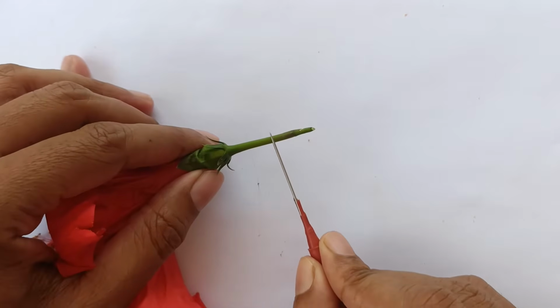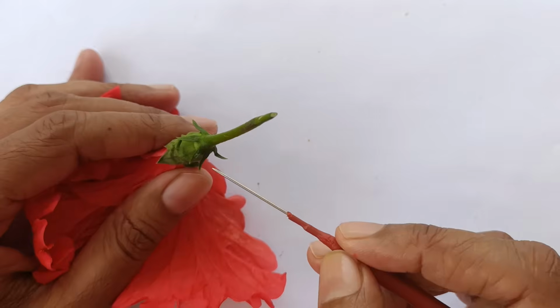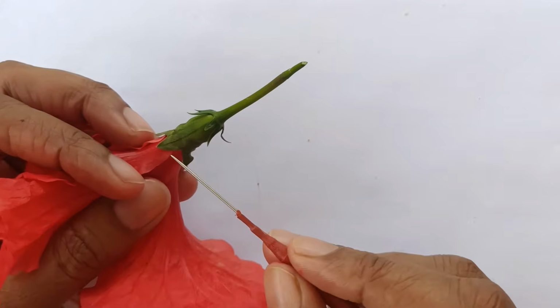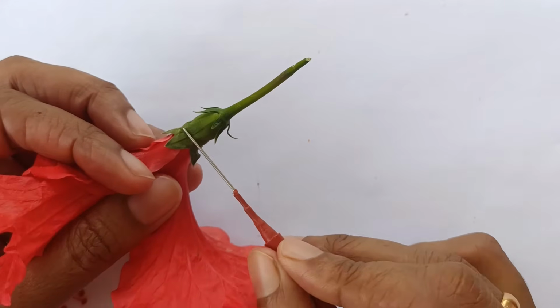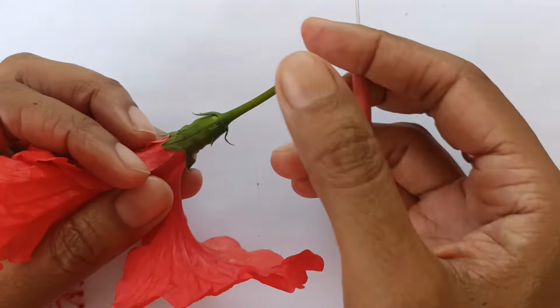This is called pedicel. This is whorl of epicalyx. You can see there are 6 epicalyx in this whorl. Then comes whorl of calyx. Unit of calyx is sepal, and you can see 5 sepals here are fused to form calyx. So it makes gamosepalous condition of calyx.